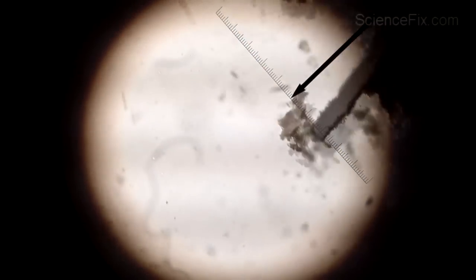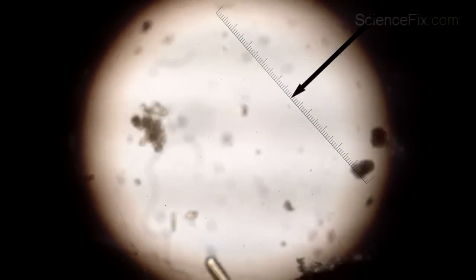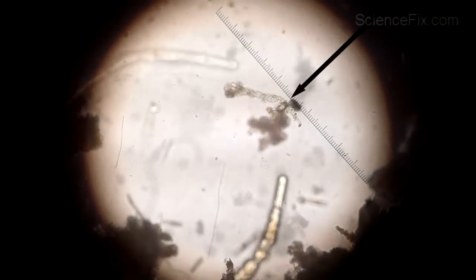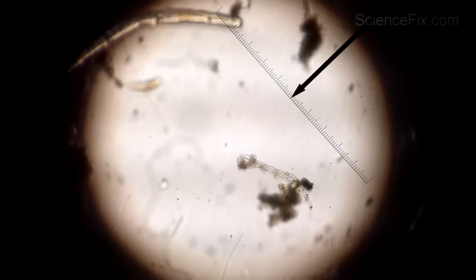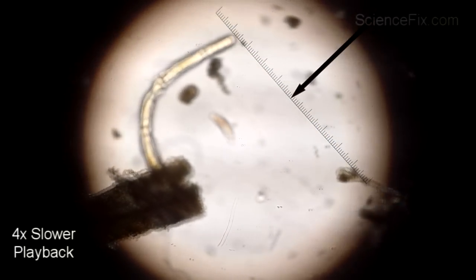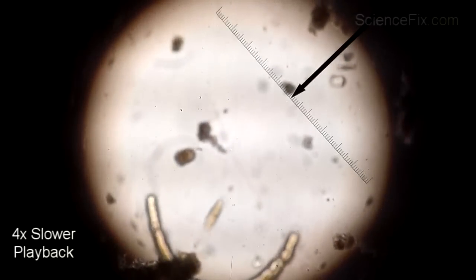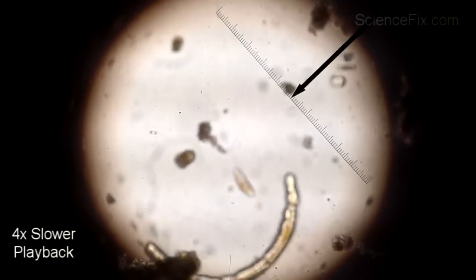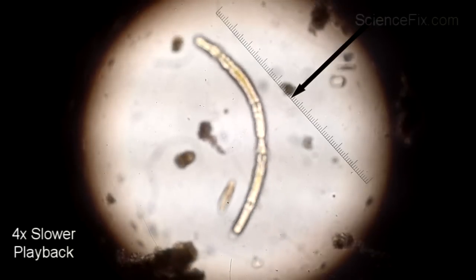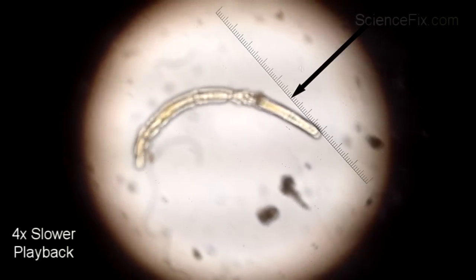With the smartphone to record video — this organism is going pretty fast — you can take that video, put it into a video editing program, and show it at much slower playback rates. You can see it in slow motion, which lets you see a little bit more detail than you would otherwise see live. So that's another advantage of using this kind of system.